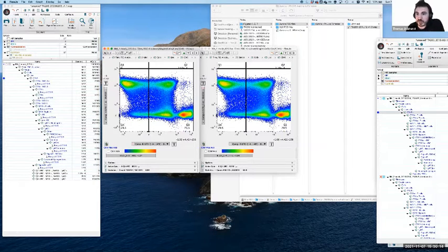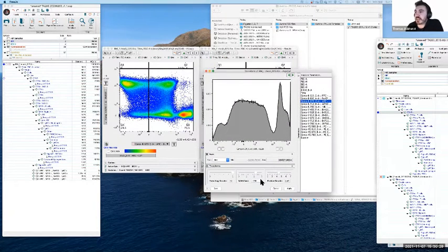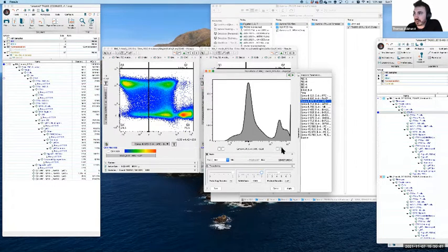Now, bi-exponential plots by definition are logarithmic, and then they switch to a linear range in the small area around 0, and then switch back to a logarithmic scale. And what we can control here, it always opens on my other screen, is how much of that negative space we want to compress into a linear area. Now, a very general rule of thumb, at least when we're doing this in real time, is that the higher the compression, the tidier the data looks.